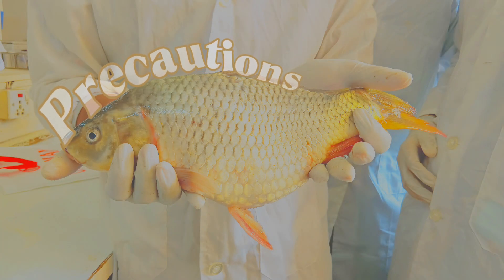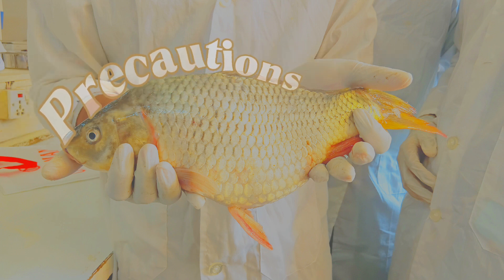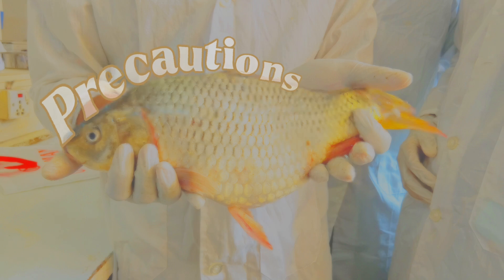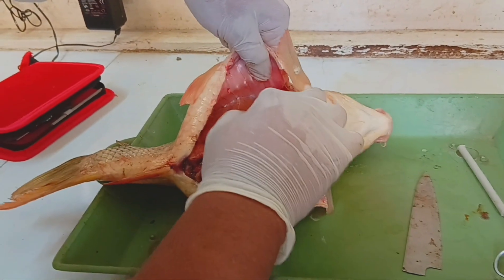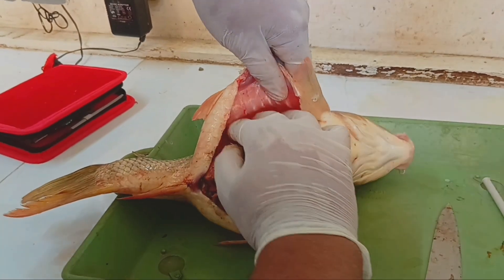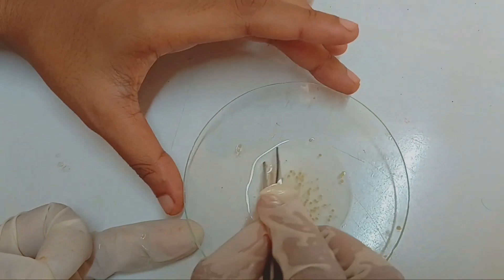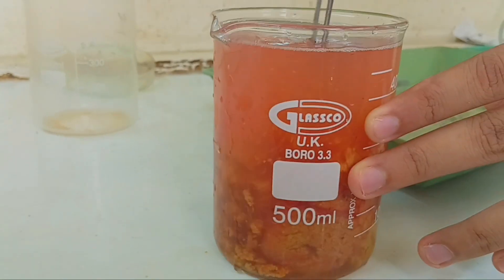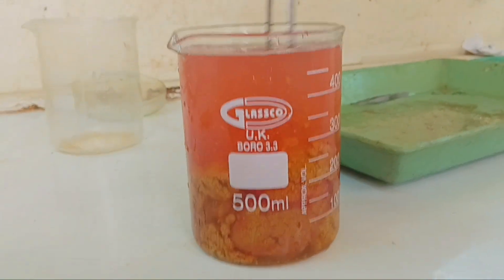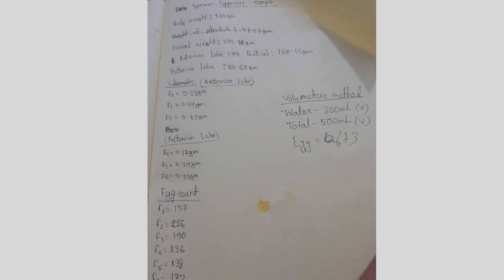During the lab work, we followed several important precautions to ensure both the accuracy of results and the safety of the procedure. The fish was handled gently throughout the dissection process to avoid damaging the ovaries or eggs. Eggs were weighed with precision. Egg counting was carried out carefully and consistently to reduce human error. In the volumetric method, uniform mixing was ensured, and all data were recorded immediately after measurement to avoid mistakes or forgetting values.